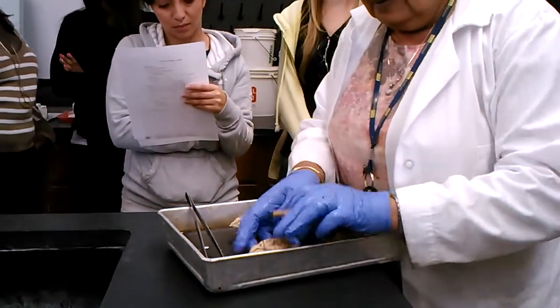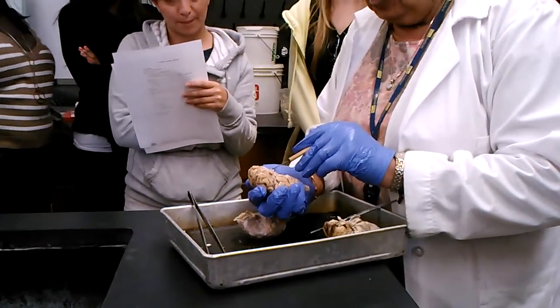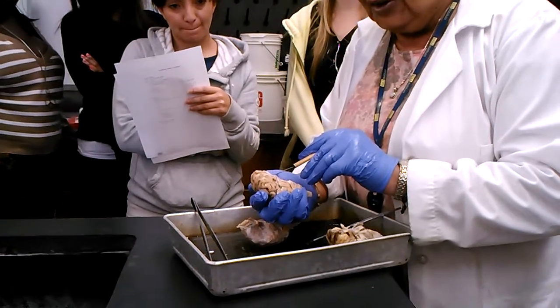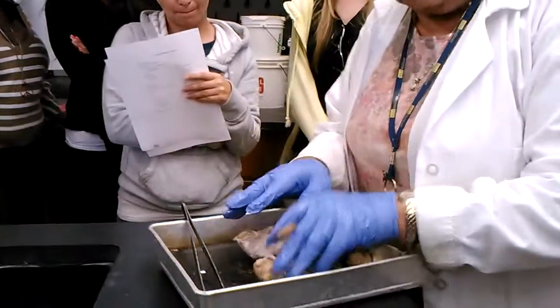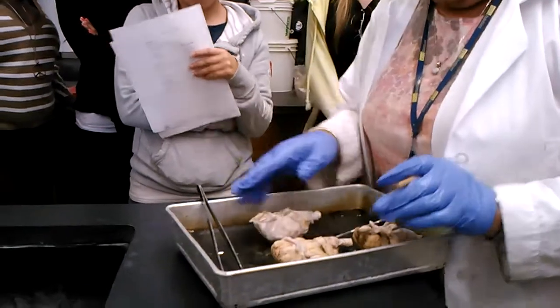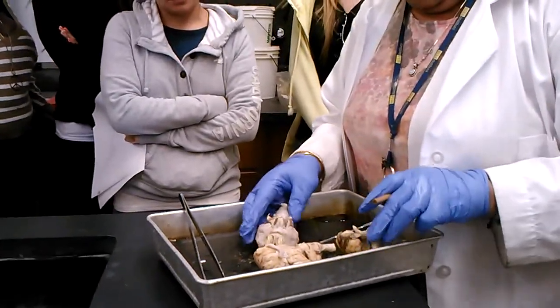So again, what is this? Optic chiasma. This is the optic nerve, that is the optic nerve. Where they meet together is the optic chiasma. These things are testable on the sheep brain because it's easier to see here than on the model, because remember I said that it's covered. The pituitary gland has been removed in all of them.